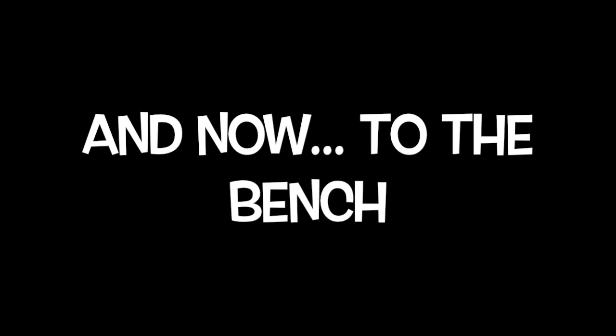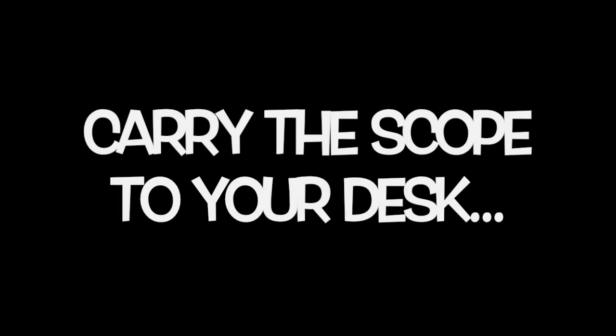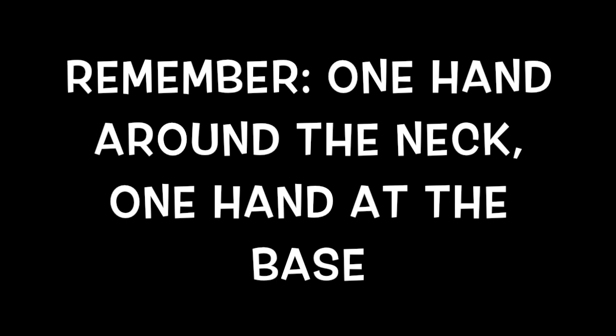Now that we have reviewed the parts of the microscope, we are going to learn how to power on and use it. Carry the microscope to your desk, placing one hand around the neck and one beneath the base. This is the only acceptable way to carry a microscope.